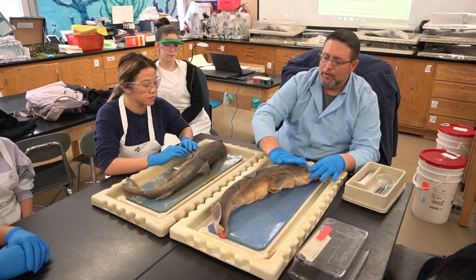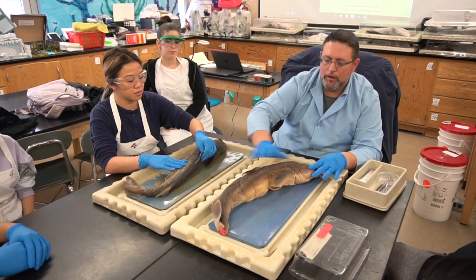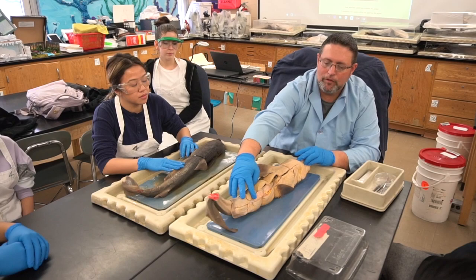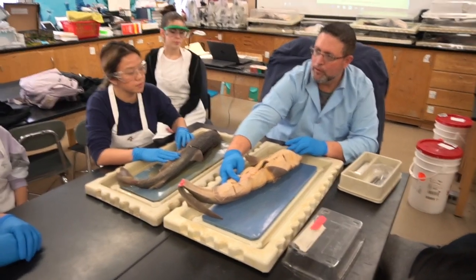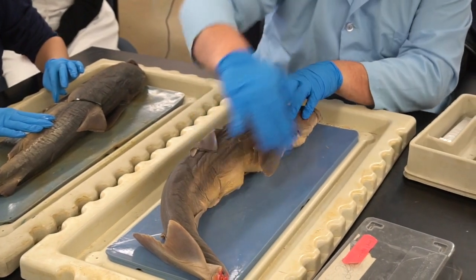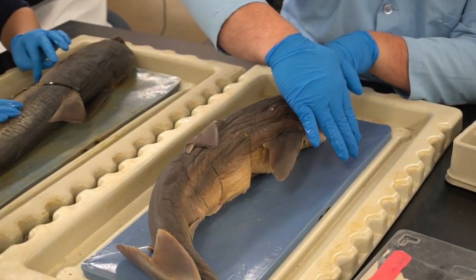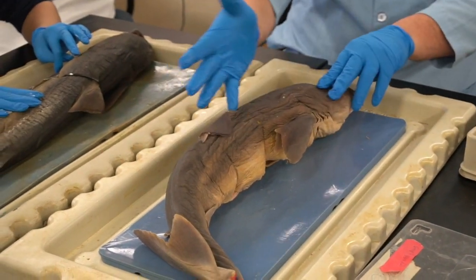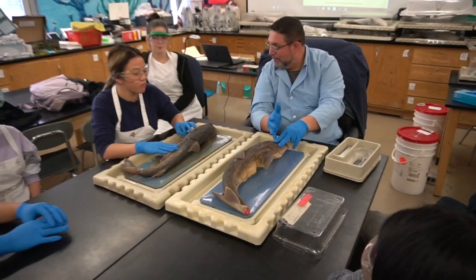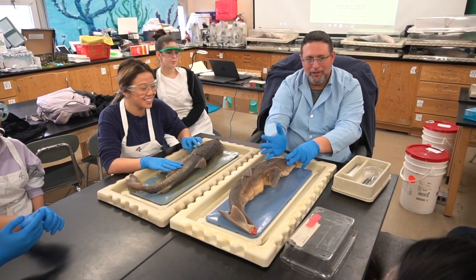Okay. The side. What's this fin called? Dorsal. Dorsal fin. This is the dorsal aspect of the animal, versus the belly side, which is the ventral. Okay, so we know the difference between those. If we're looking at the side of the animal, it's a vocabulary word that started with the letter L. This is the blank. Lateral. Okay, down the middle, what's the M word? Down the middle. Okay, strike one there. Medial. Medial, down the middle.